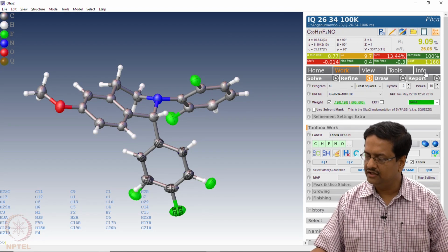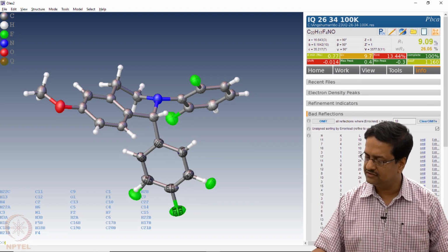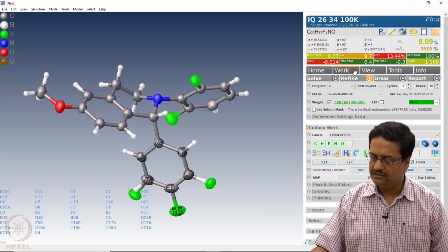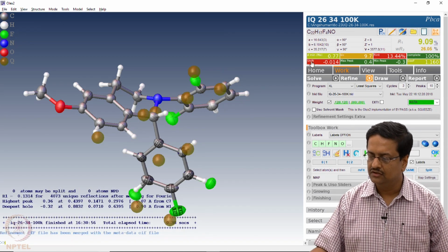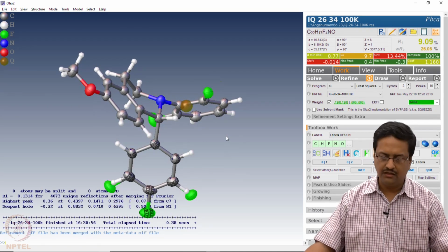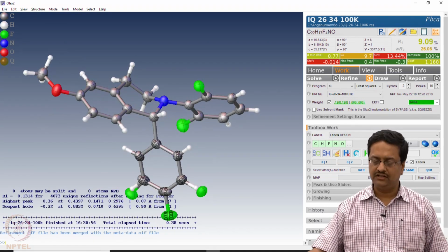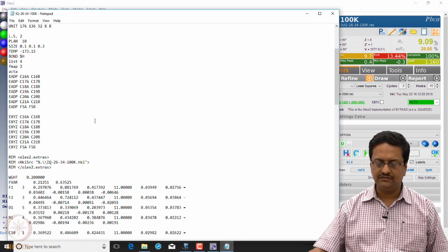This is not reducing, so we may try to see the bad reflections. Here we don't see much of bad reflection, so we cannot do much here, and we should leave it and try to complete the refinement, if at all, to a very small shift. So this is how one can do a disorder treatment using the EADP and EXYZ commands.